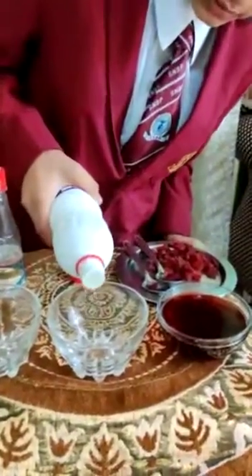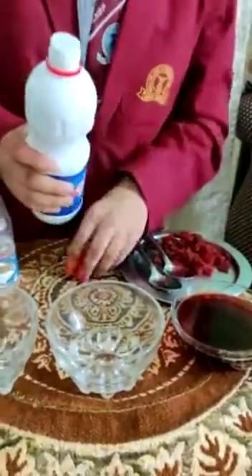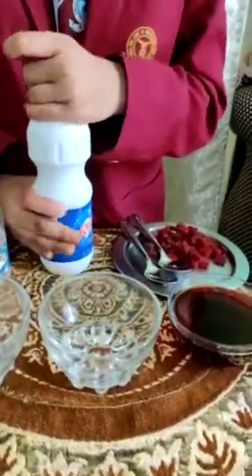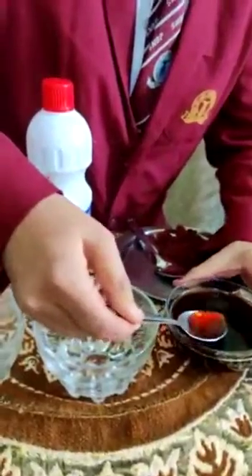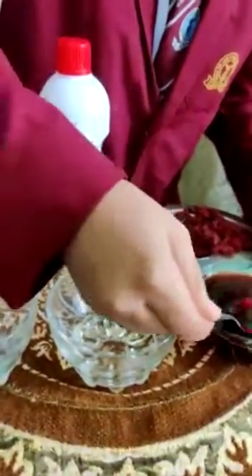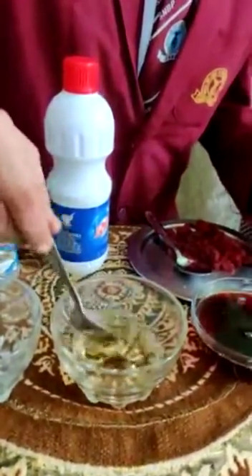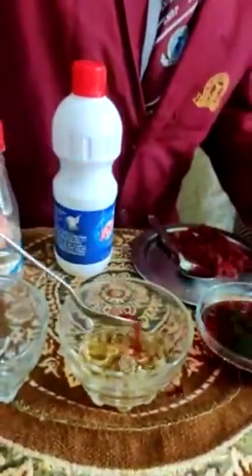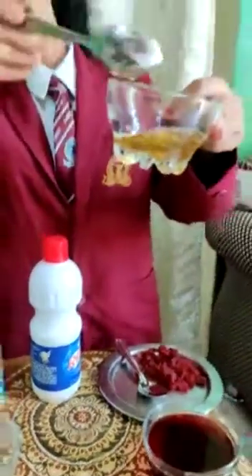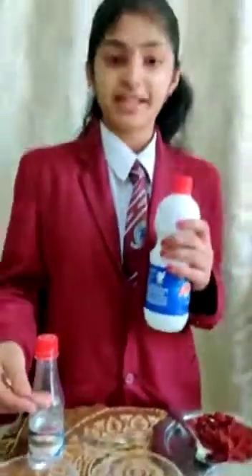Adding a few drops of bleach. As you can see, it has turned into a brownish — yellowish-brown — color. This means that bleach is basic in nature.